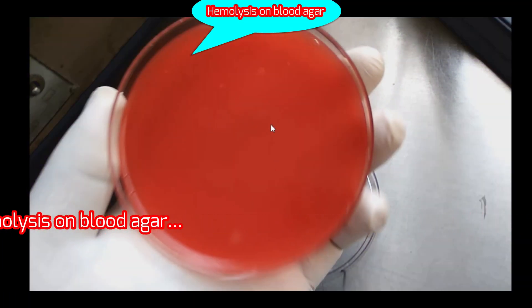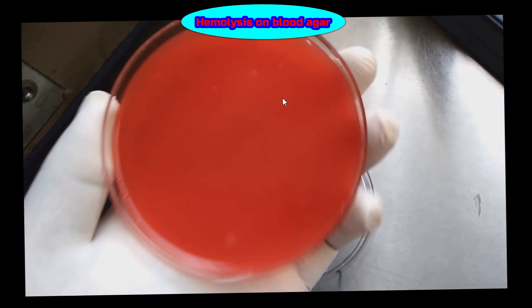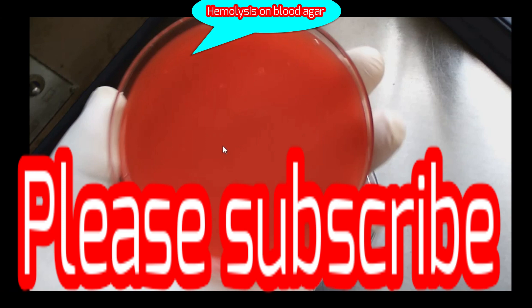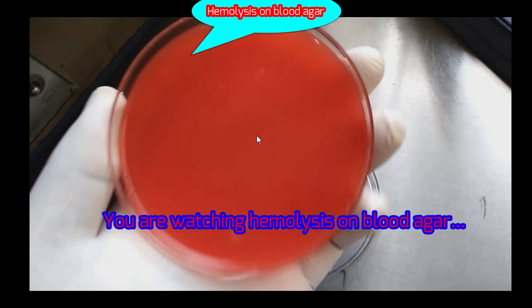This clip is concerned with blood agar. As you know, blood agar is an enriched medium. Organisms that cannot grow on nutrient agar are easily grown on blood agar — for example, streptococci, Corynebacterium diphtheria, and so on. On the basis of hemolysis, organisms are also classified using blood agar: whether alpha hemolytic, beta hemolytic, or gamma hemolytic.